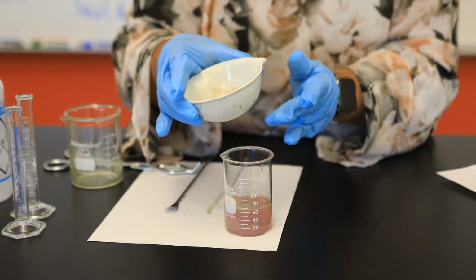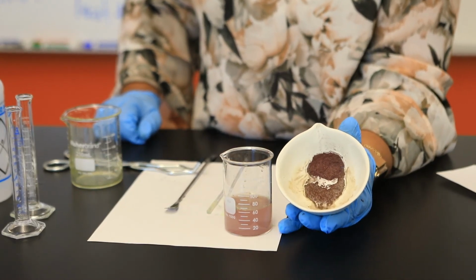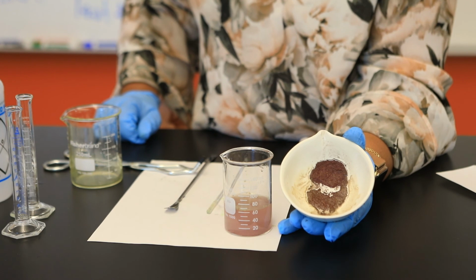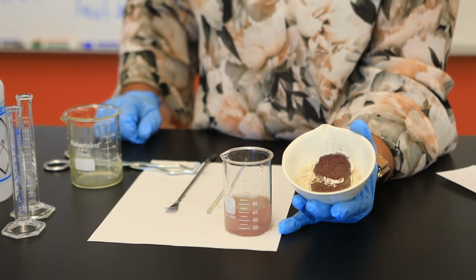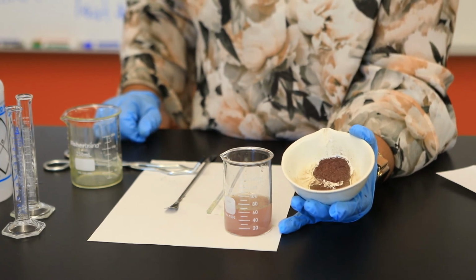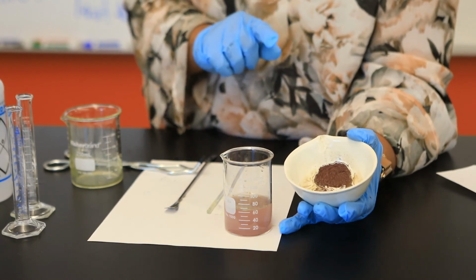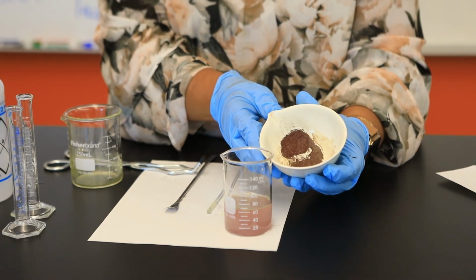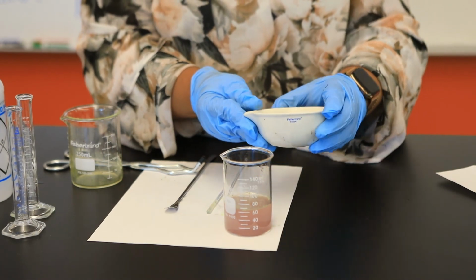So now here's going to be our next challenge. So my copper is a reddish brown solid. The goal now is to make sure that we determine what? The exact mass of this solid without heating too vigorously. Why? Because if this is heated vigorously, what's going to happen is that this reddish brown copper metal will be converted to black copper(II) oxide. So we're going to gently heat.